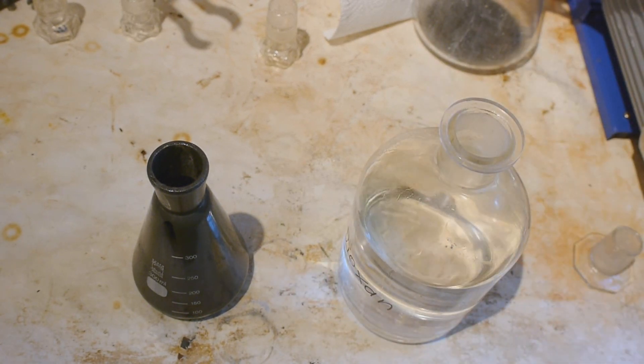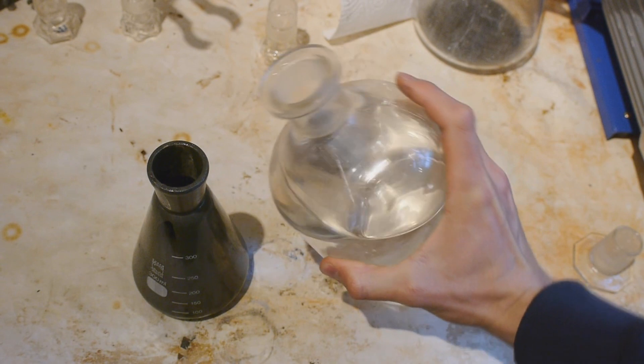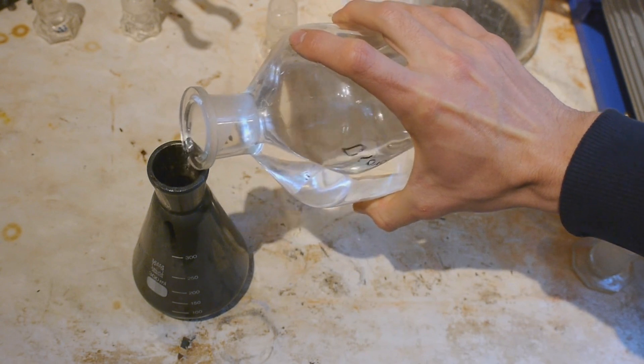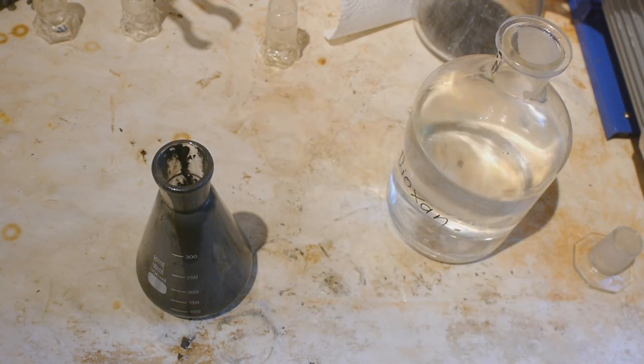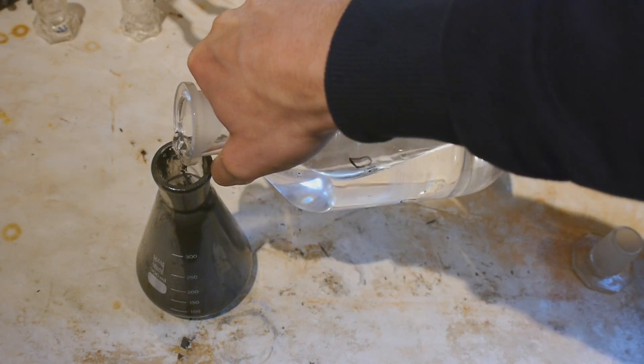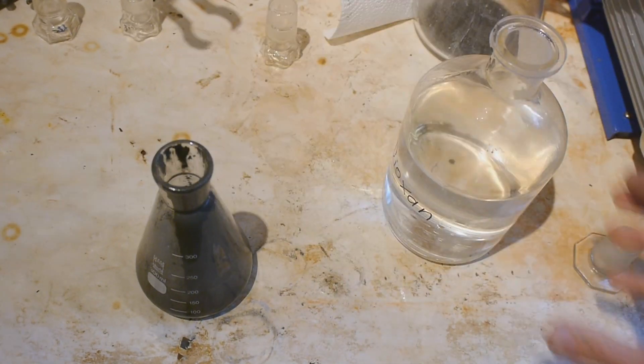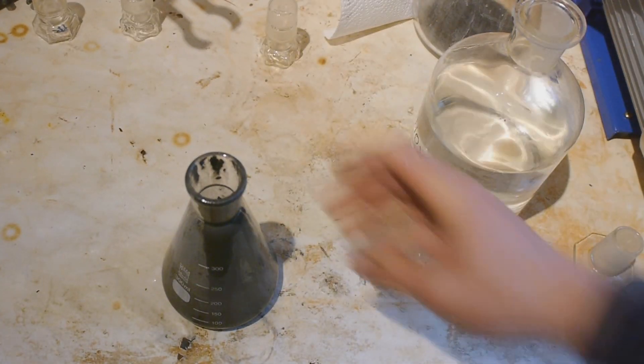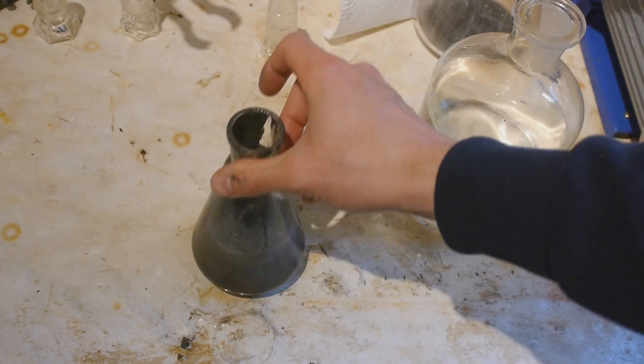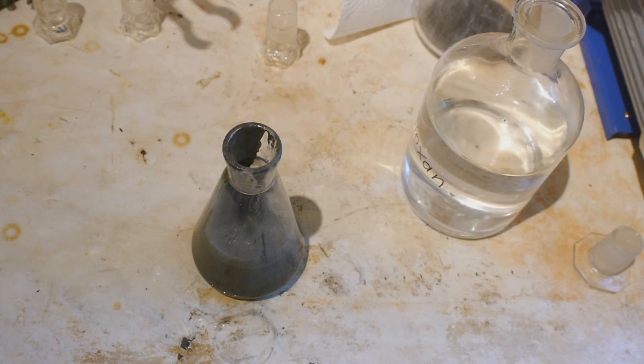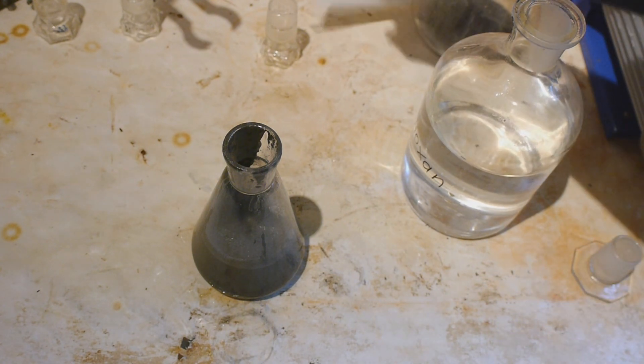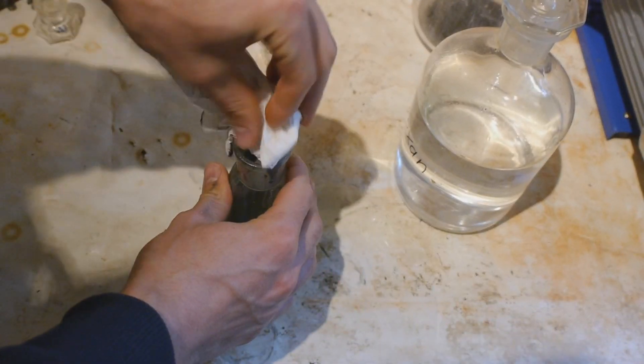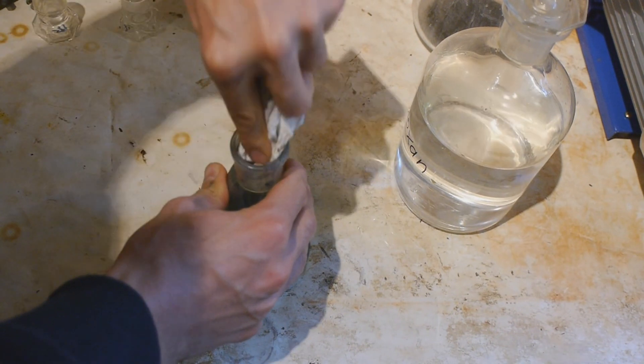And now I will add some of this carcinogenic dioxane. Can you hear it fizzing? That's bad. Means the dioxane contains water. So I hope it's not too impure. It is fizzing horribly. Let's fill it up to the 200ml mark. Oh my god this is foaming like crazy. I'm afraid I just destroyed everything. Didn't know the dioxane was so incredibly wet. Anyway I will just try to wipe this clean and then I will try to reflux it. Maybe we might still be getting some sodium. If not at least we tried.